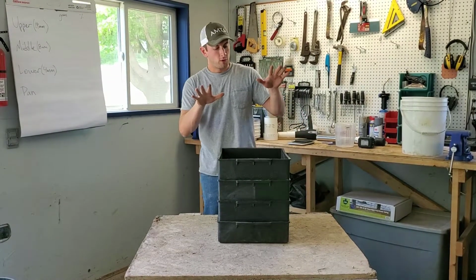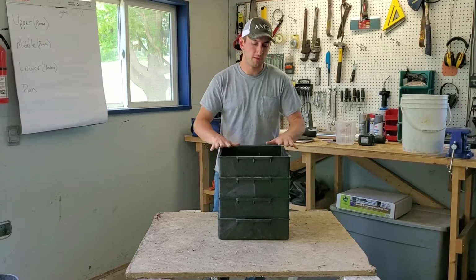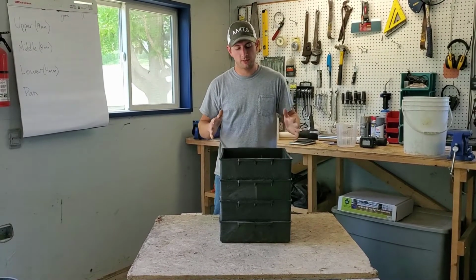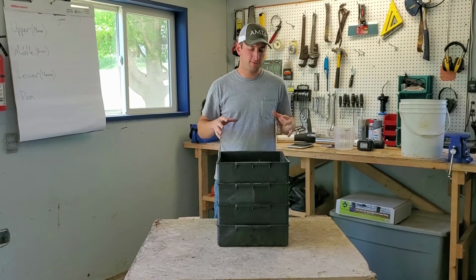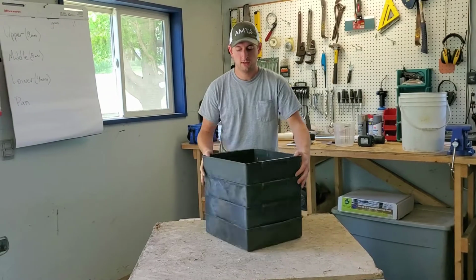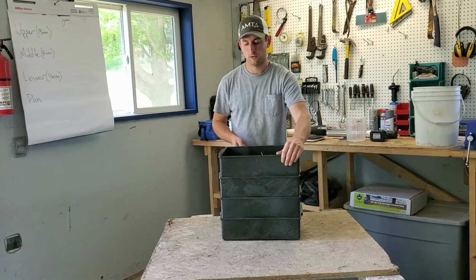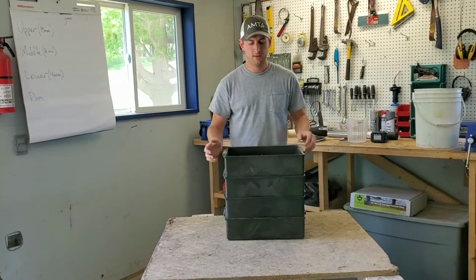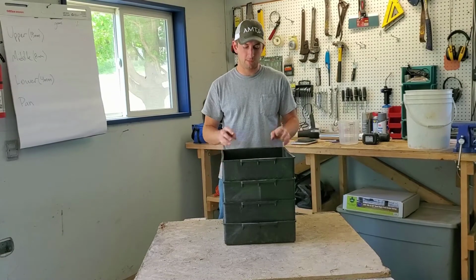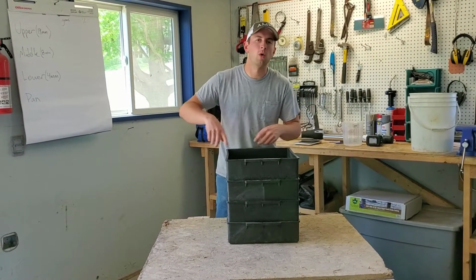What we're going to do is shake the box horizontally. We want no vertical movement. This all needs to be horizontal. We're going to shake the box 40 times, and we want to do that in sets of 5. So we will shake 5 times in one direction, turn it a quarter turn, shake it 5 times, and then do that again this way and this way. Then we'll make sure that we don't have any particles on top that are clumped together. I'll have to pull that apart if we have that. And then we'll go around again.